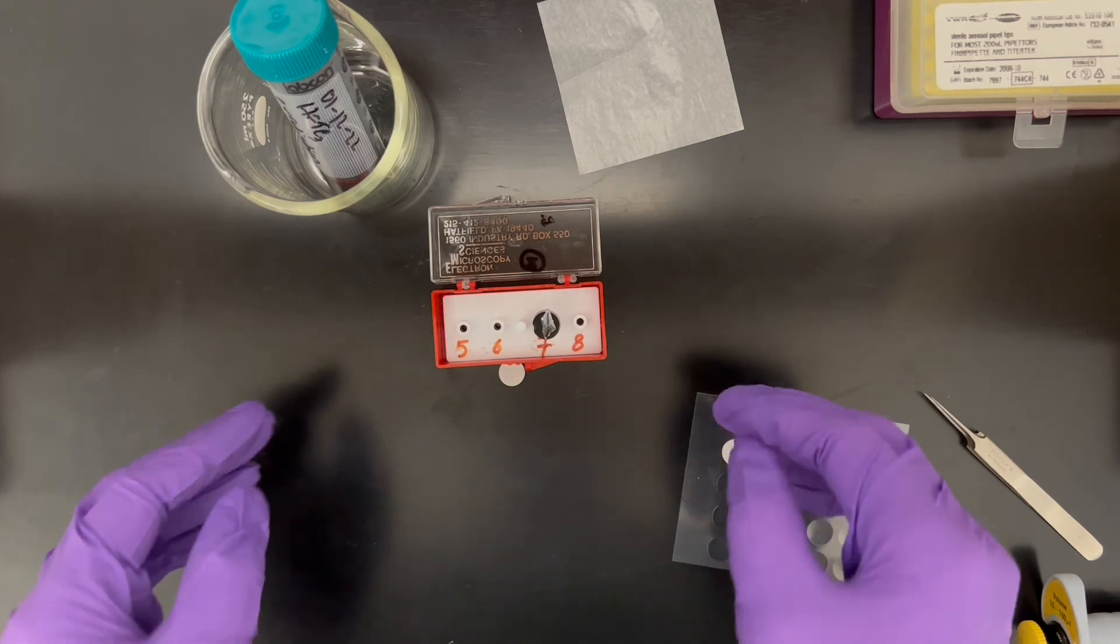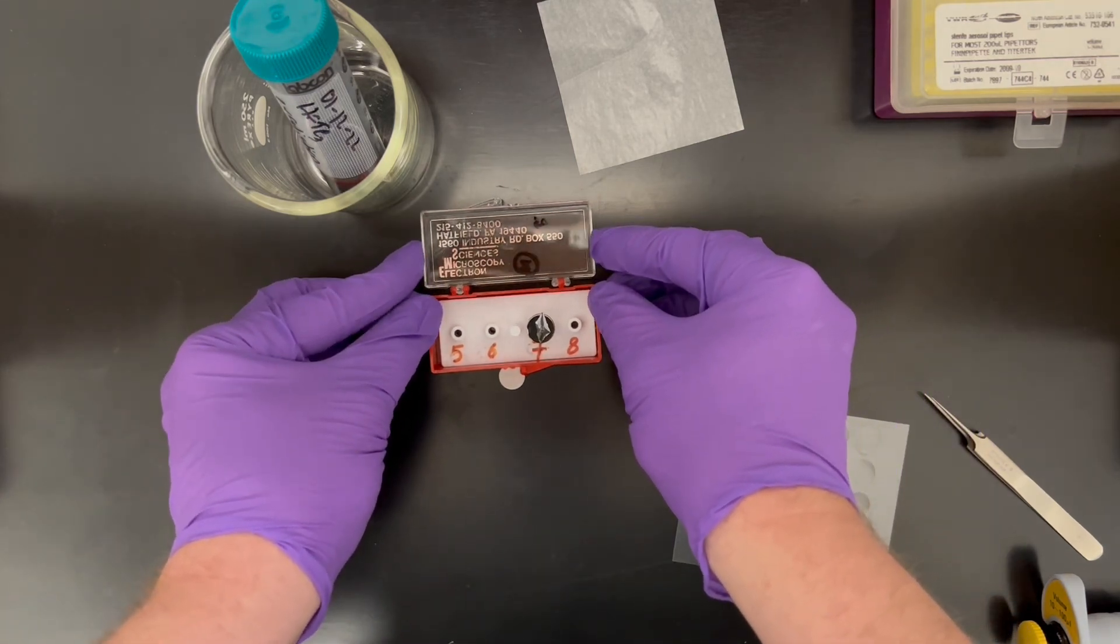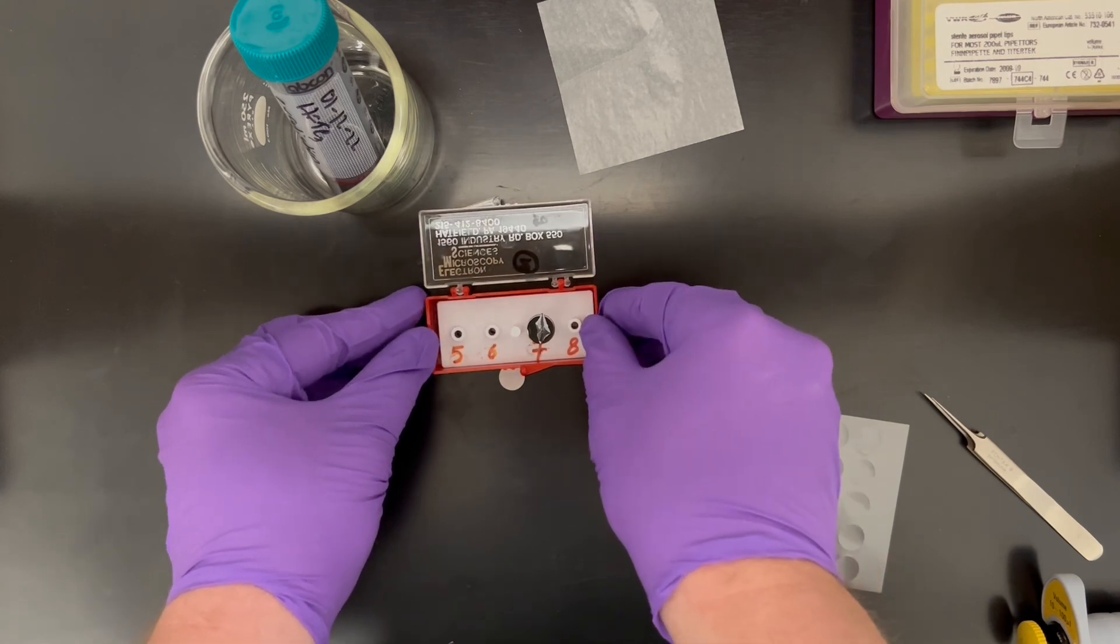And that is how you would prepare a sample in solution for SEM analysis.